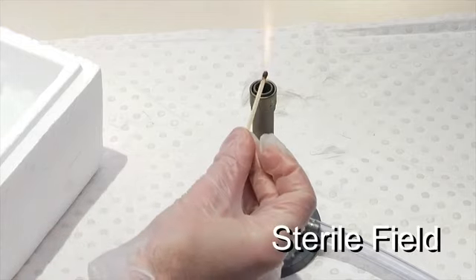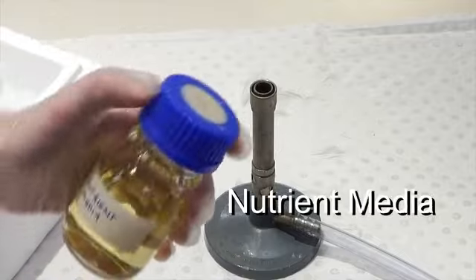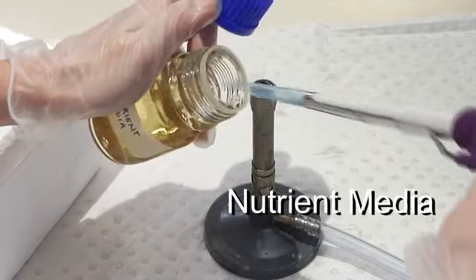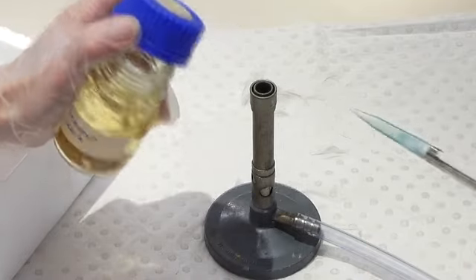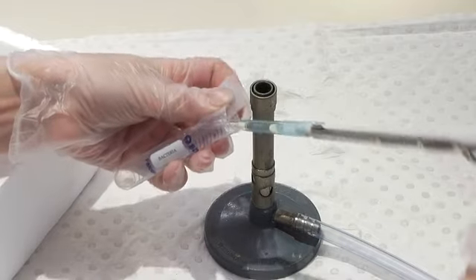Then we're going to apply a short blast of heat, just to shock the bacteria into taking up the DNA. We then create a sterile field and take a sample of some nutrient media to add to the mix. Nutrient media provides all of the essential nutrients for bacterial growth.